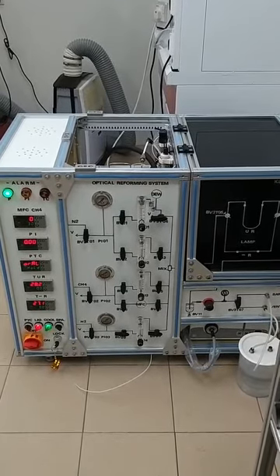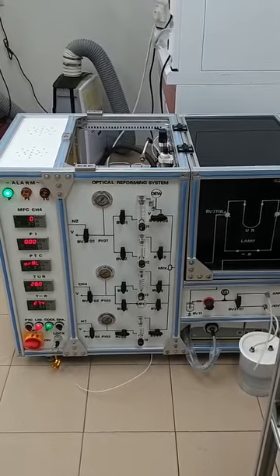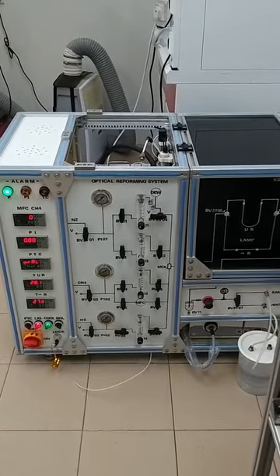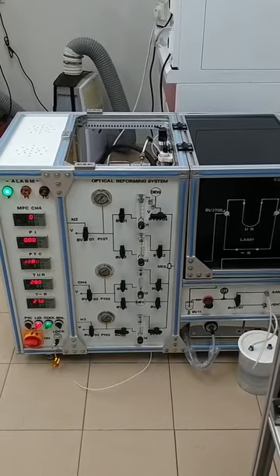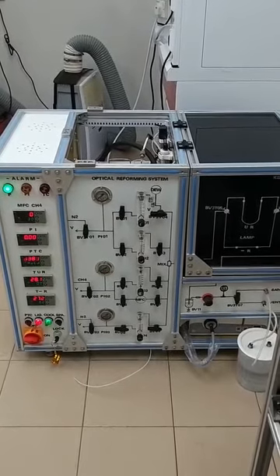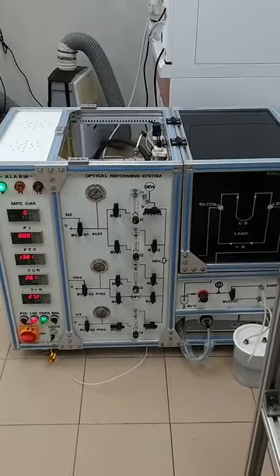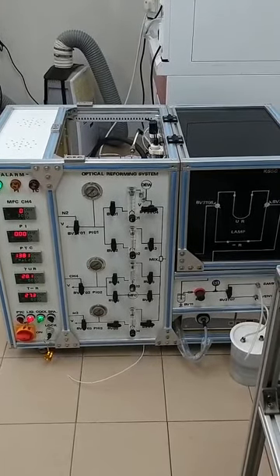Methane in this line is the reacting gas. You can replace it with other gas, following your experimental design, like carbon dioxide. There is one mass flow controller installed in this line to supply a high accuracy flow rate for the reactant gas. But you can also use it for other gas with the calibration factors.